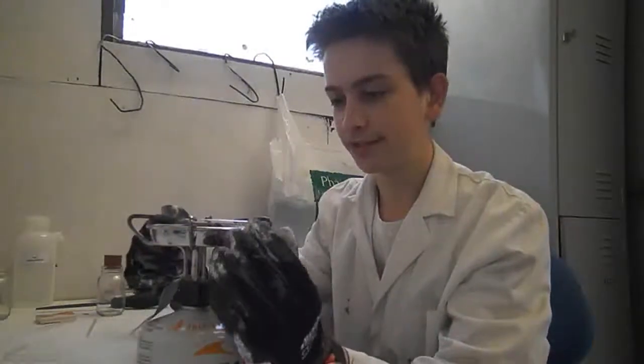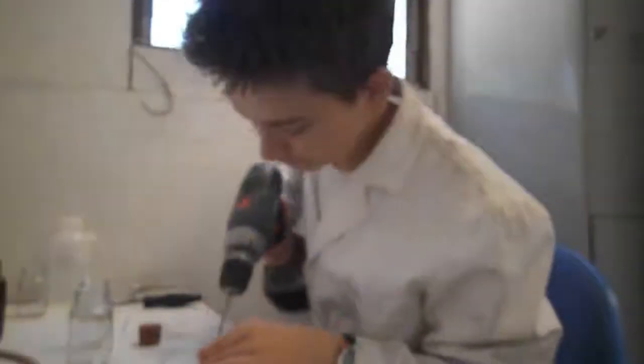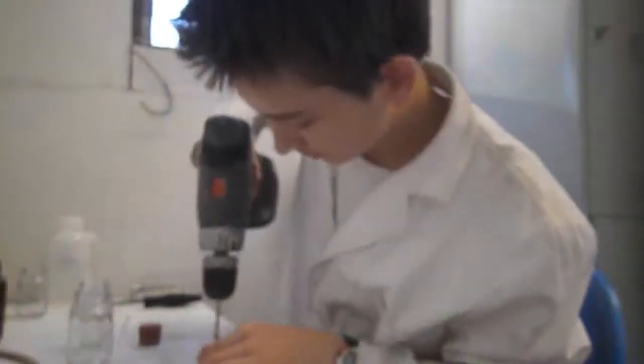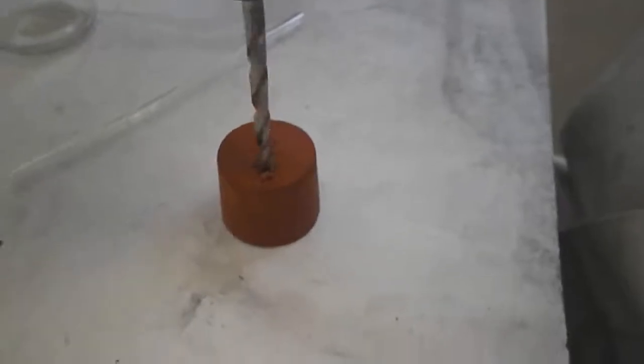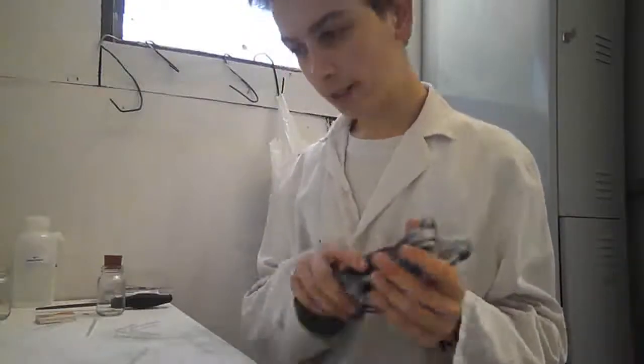The issue with this is, obviously, I'm probably gonna hurt myself. Hopefully I don't kill myself, because that would suck. Oh, that looks really cool. I will do the next little bit, and I'll show you when I'm ready.